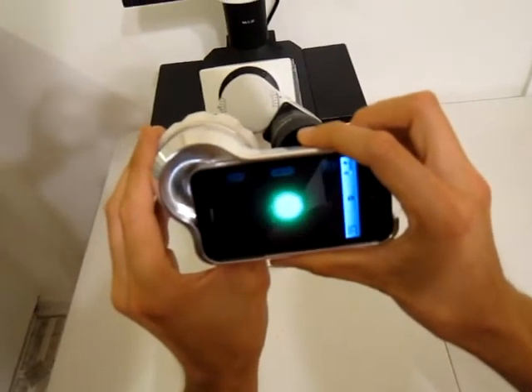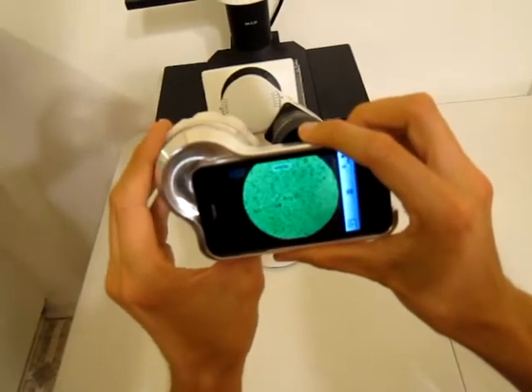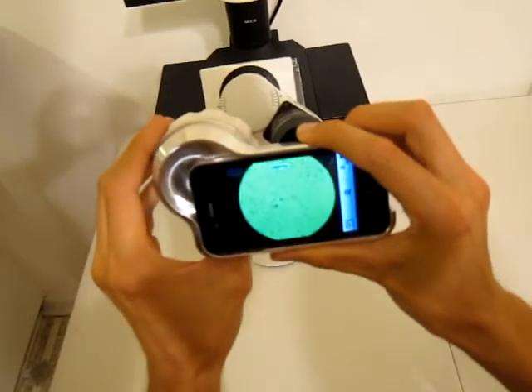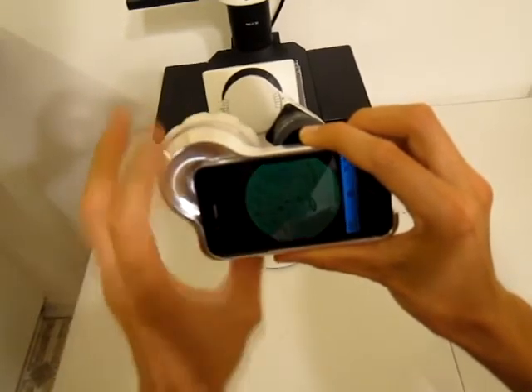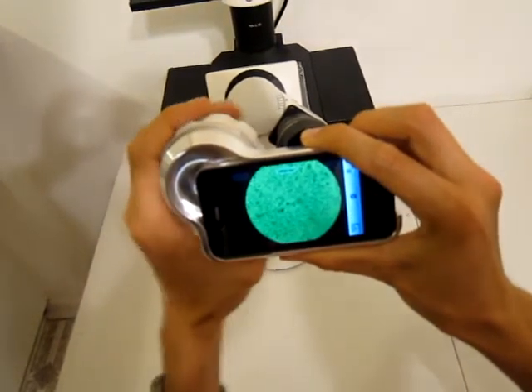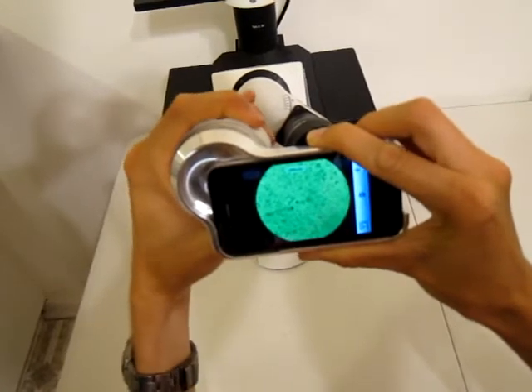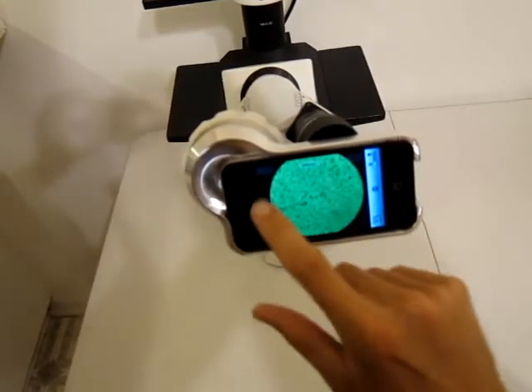Try to keep the light — you'll see a point of light — try to keep it centered until everything comes into focus and then keep it aligned. Turn the tightening knob clockwise and make sure the edges around here remain crisp.